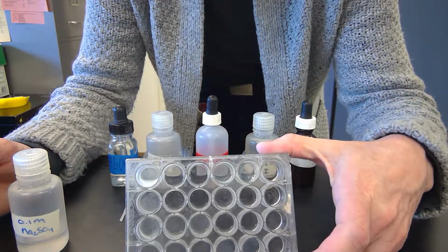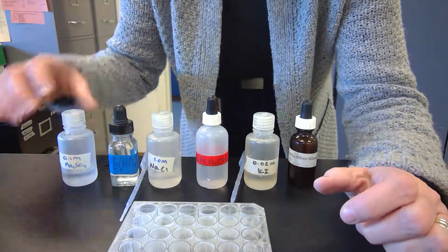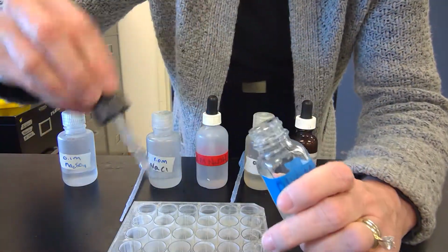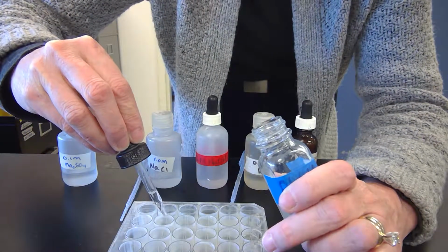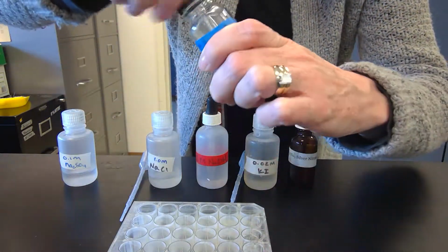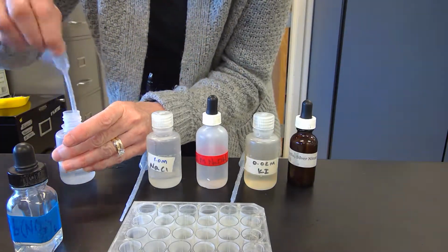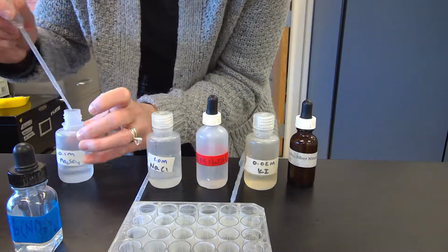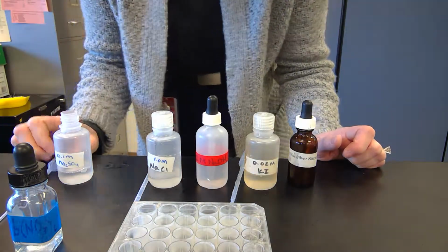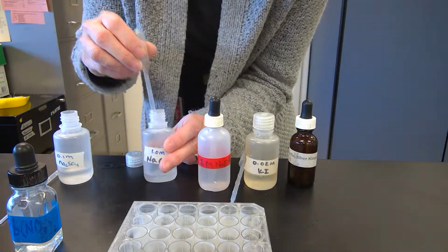So if you look at those, you can see the white, and then I would say no reactions on the other ones. Then in the next one, we're going to put lead nitrate in all of them and then react the other ones with it. So we'll put a couple of drops. Our first one is going to be sodium sulfate. That gives us a nice white one. We might have already done that, but that's okay. Then I won't lose track of what I'm doing.